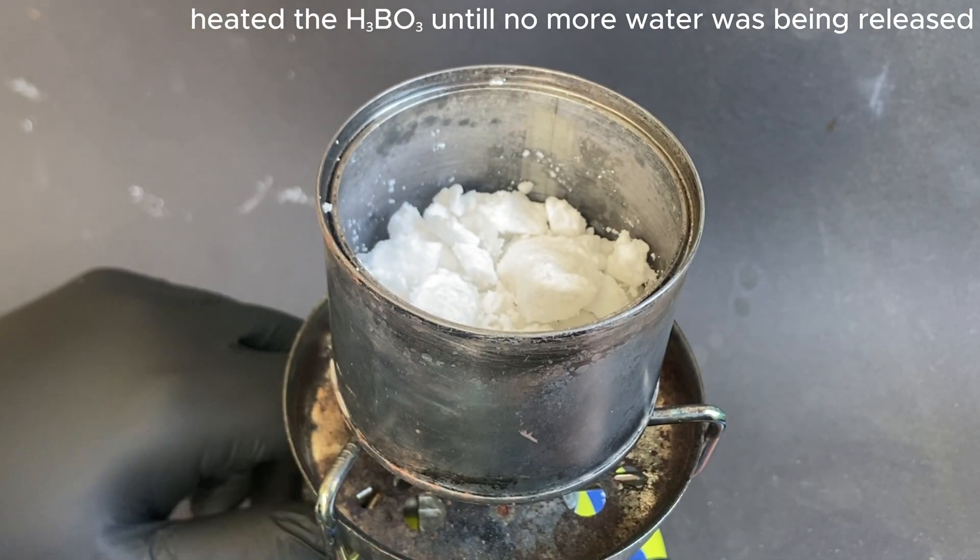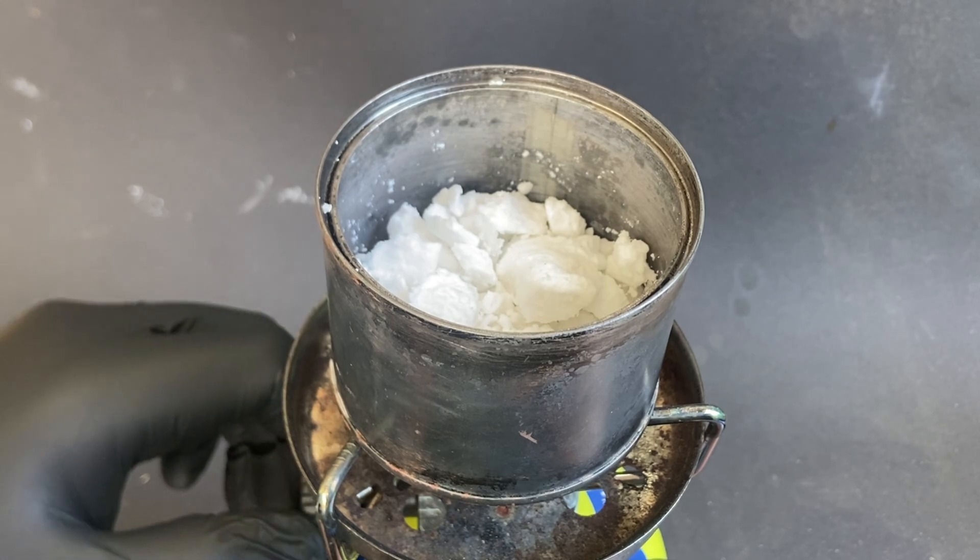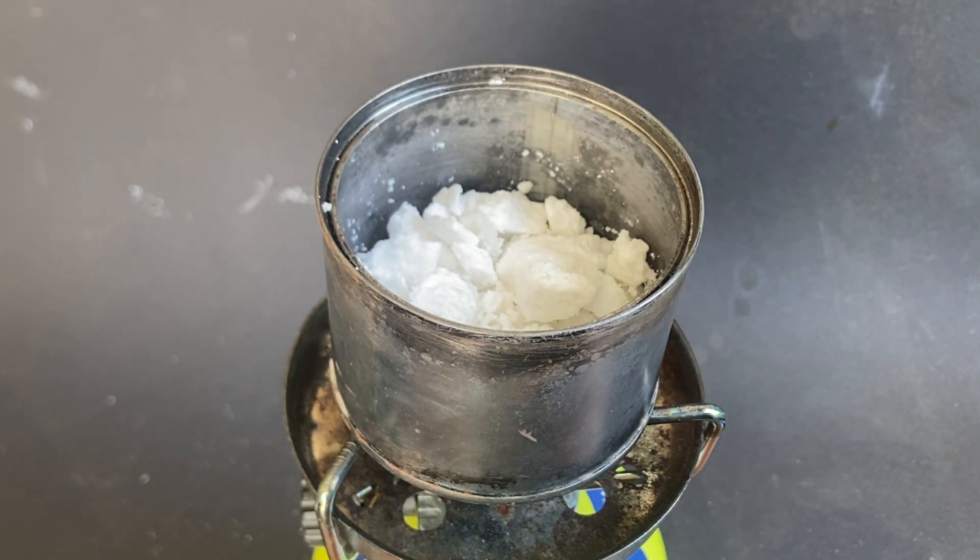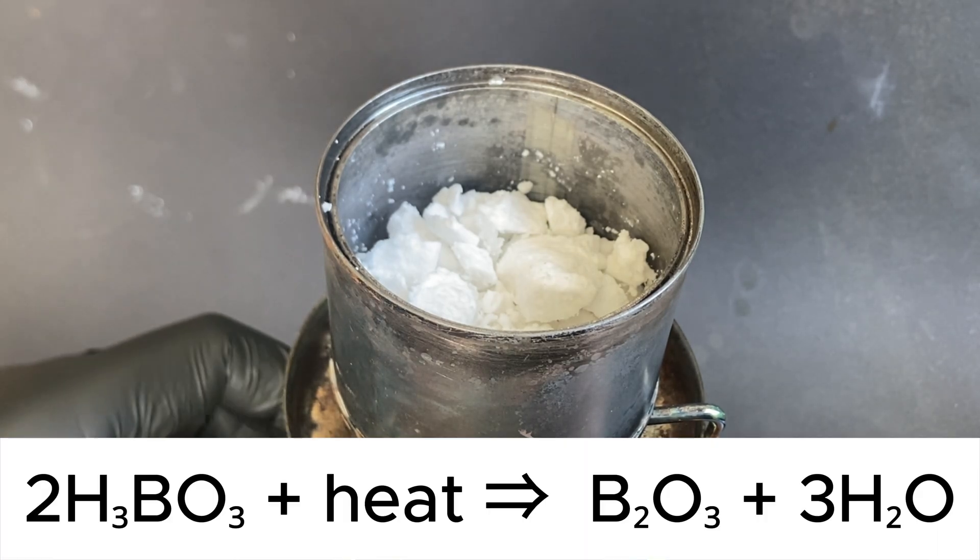Next I added the boric acid to a steel can and started heating it. The boric acid decomposes to form water which evaporates and boron oxide which stays at the bottom of the can.